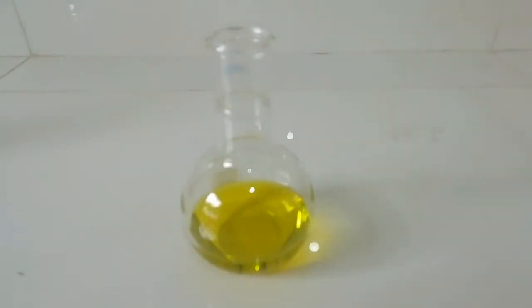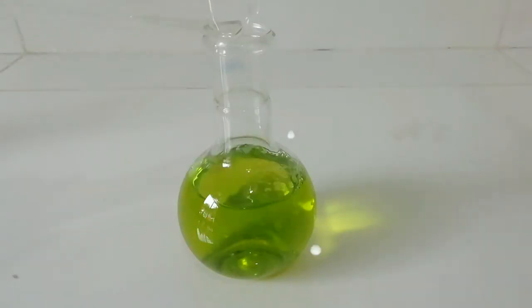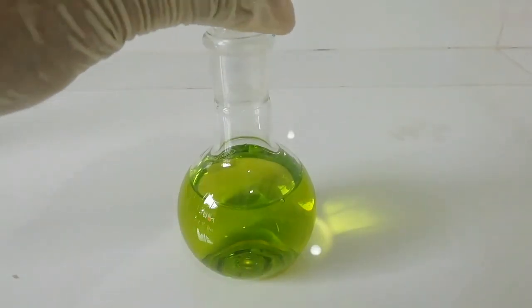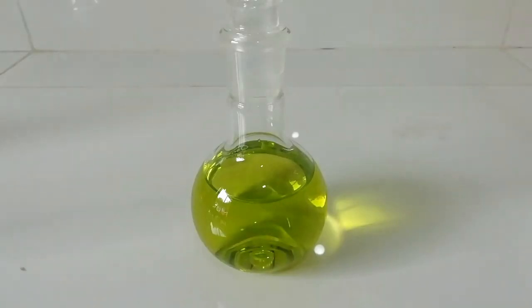Now I am going to add glucose solution. Then I place the lid and wait until this solution becomes yellow color. Okay, now the solution is ready to get the color changes.